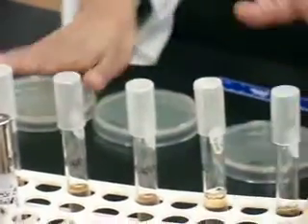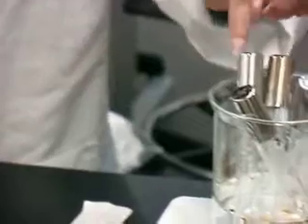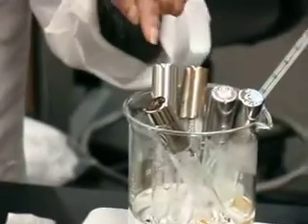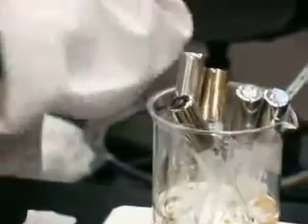So once you have the dilution series made, the next thing we want to check is whether our bacteria is at the right temperature. Okay, so it has been cooled to 50 degrees. Now I want to introduce 2 drops of the E. coli B strain into each of the tubes, because we are going to add the virus into the soft agar tube along with the E. coli, shake it and pour it onto the plate.